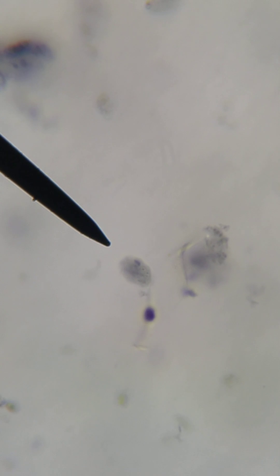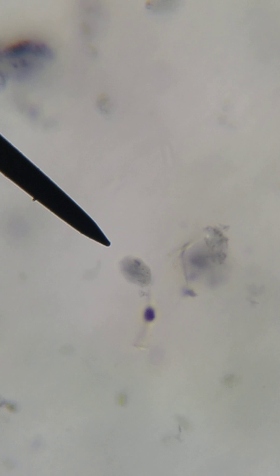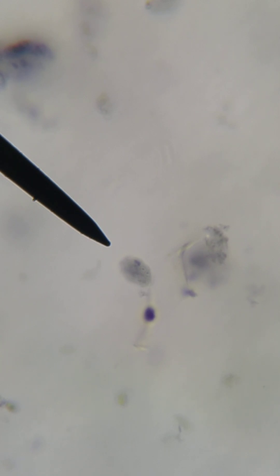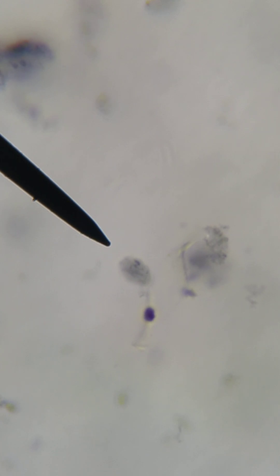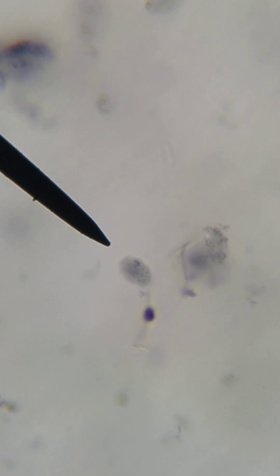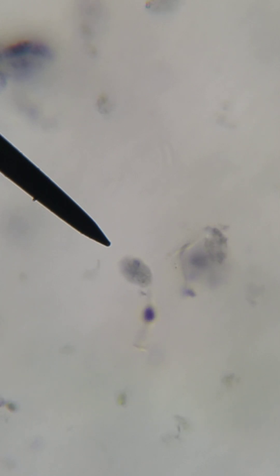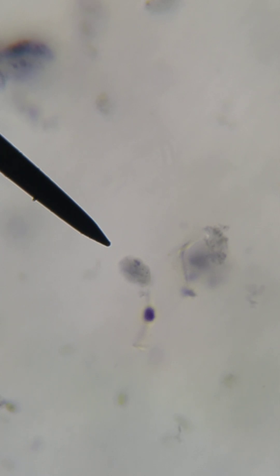The ventral sucker disc ends up adhering the trophozoite to the epithelium of the intestinal villi, and that is where it does its job. It sloughs off basically every 72 hours because your cells within the gastrointestinal system are constantly regenerating due to all the movement happening in your GI tract. This is a trichrome stain smear — this is a cyst, and I don't have any trophozoites on this slide.